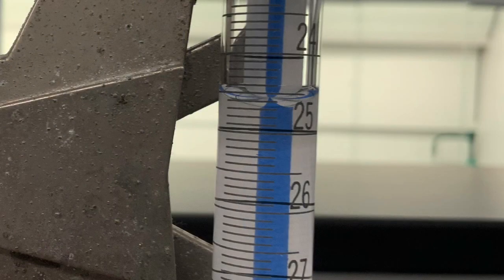Last step is to determine the volume of EDTA solution in the burette. We know the concentration of that solution, and we can now calculate, based on how much EDTA was consumed, how much calcium was in the flask containing 1 milliliter of scale solution with unknown calcium concentration.